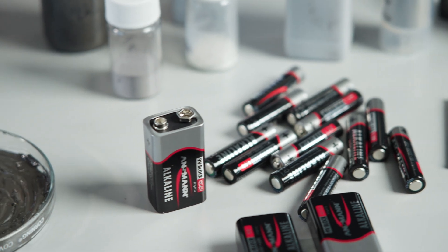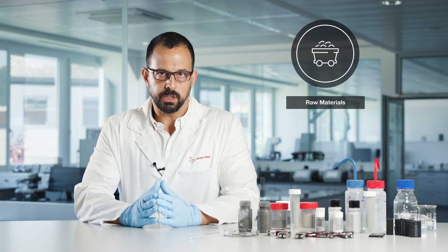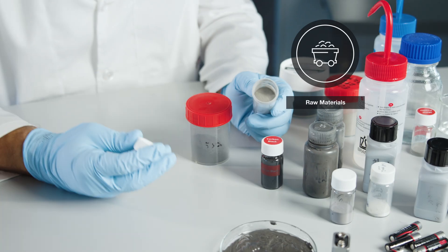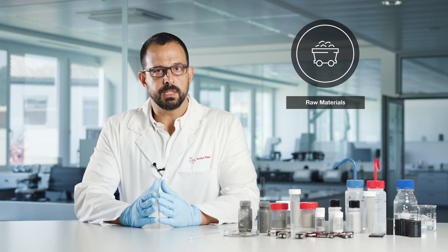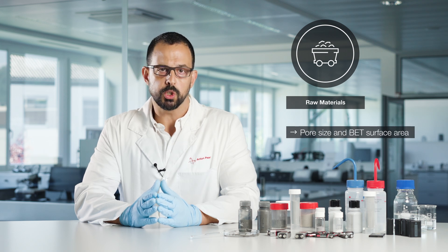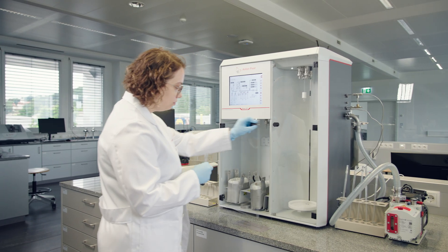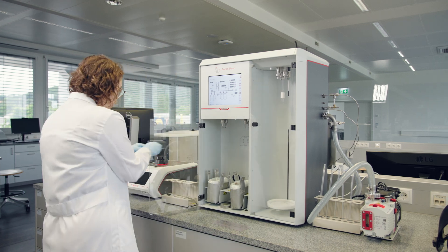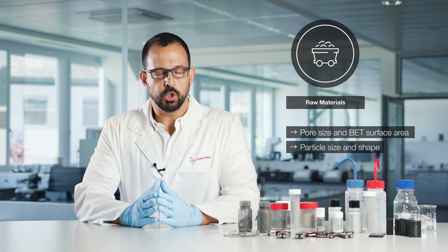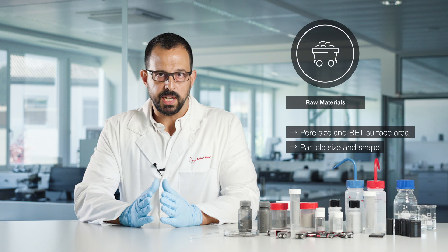A typical process starts with the production of the electrodes. For this purpose, the starting point is powder raw material, such as NMC or LFP for cathode and graphite for anode. At this stage, properties such as pore size and BET surface area, which is also known as specific surface area, are measured with a gas sorption analyzer, also known as surface area analyzer. Particle size and size distribution are measured with laser diffraction or with dynamic light scattering technology, depending on the size of the particles.